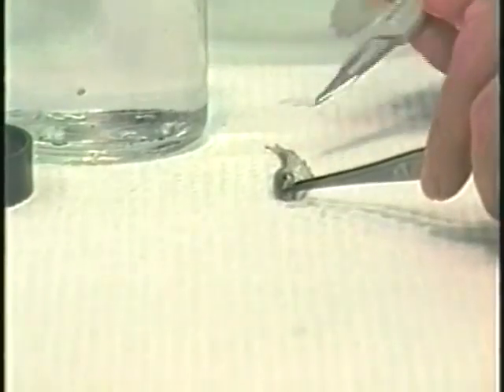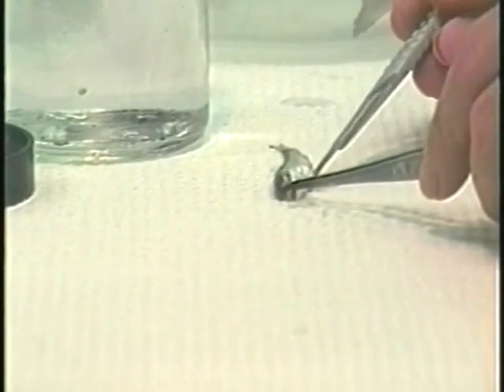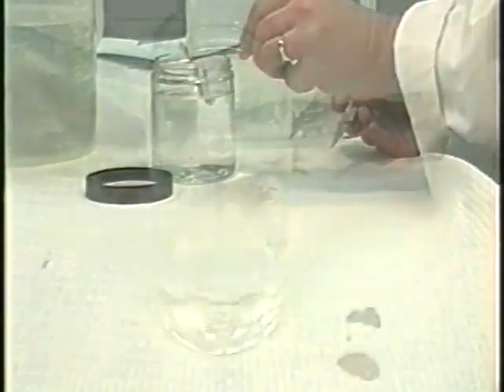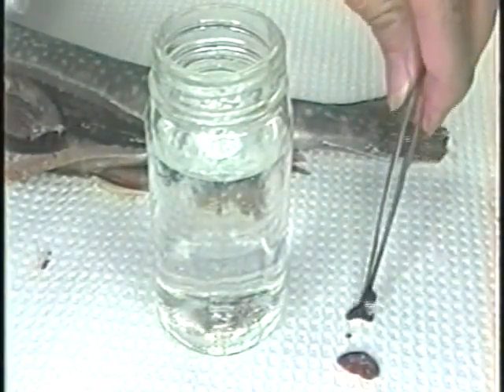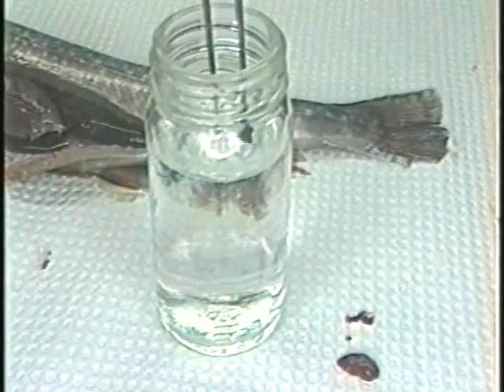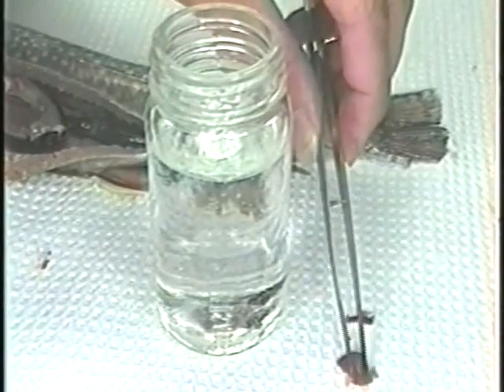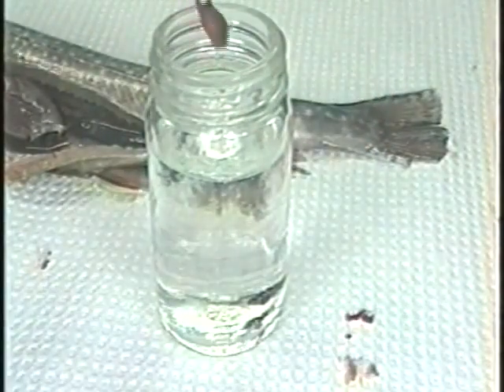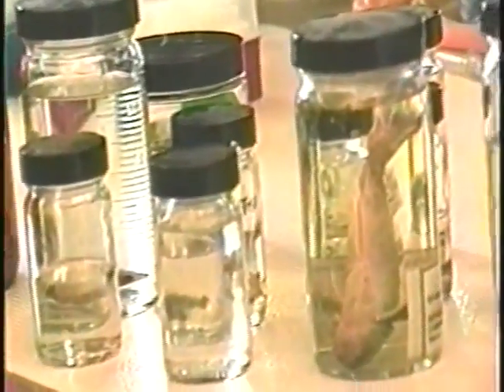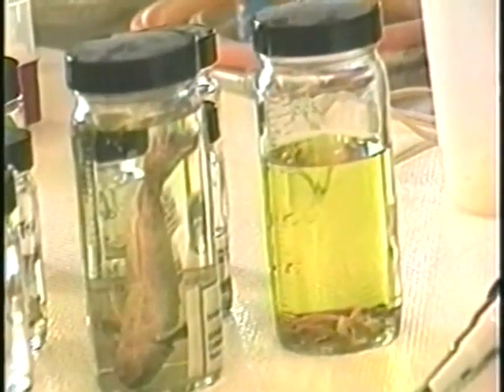Very small fry may be preserved whole by making cuts in the muscle behind the cranium and in the abdominal wall to ensure the fixative has access to all tissues. Tissue should be placed immediately in a volume of fixative that is at least 10 times, but preferably 30 times, that of the sample. For example, a cubic centimeter sized piece of tissue should be placed in at least 10 mL of fixative. A variety of fixatives are used, but the most common is 10% phosphate buffered formalin.